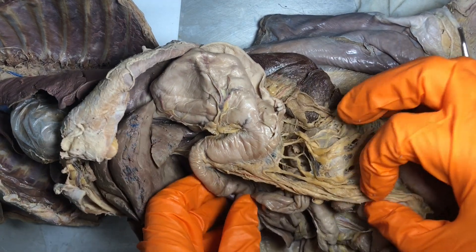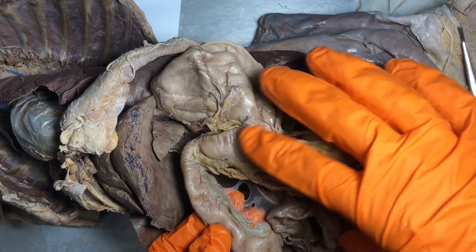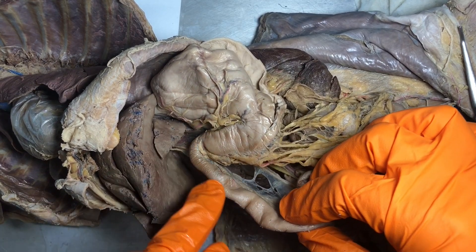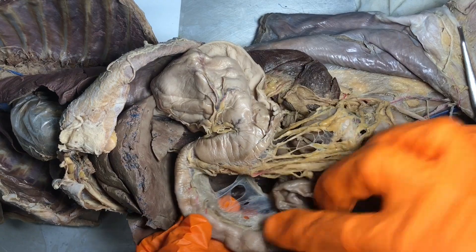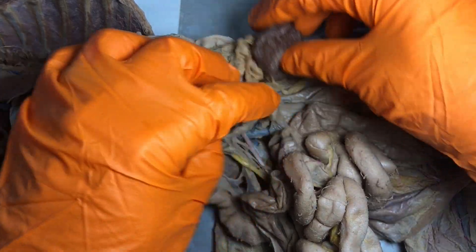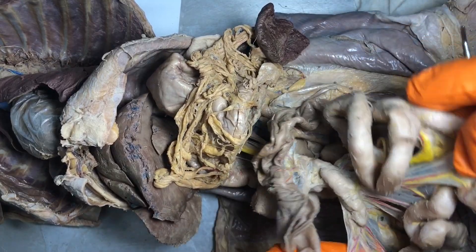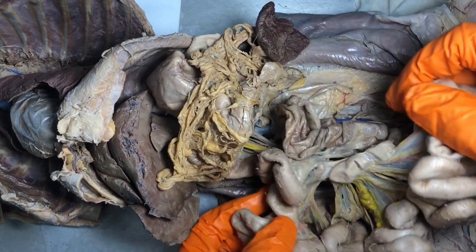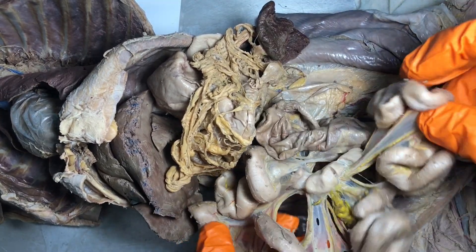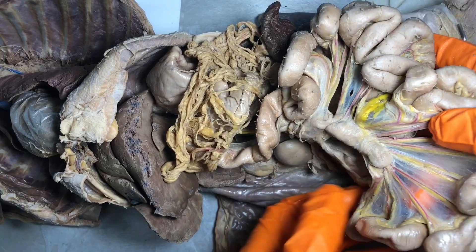Let's go now into the small intestine. Remember that first part of the small intestine is the shortest part — in humans it's about 10 inches, obviously not 10 inches on the kitty. That first part is called the duodenum. The middle portion is called the jejunum; for humans that makes up about seven and a half feet of the small bowel. If we were to just keep going and follow this, all of this right here is the jejunum. Then the ileum, which is the distal end of the small bowel, is the longest portion — in humans that's about 11 and a half feet.